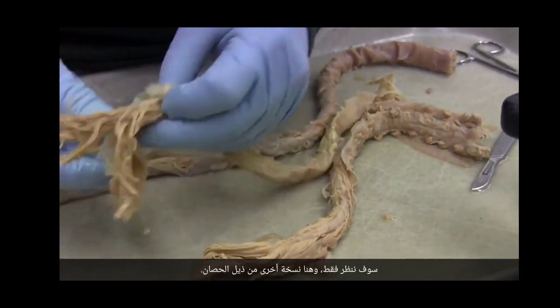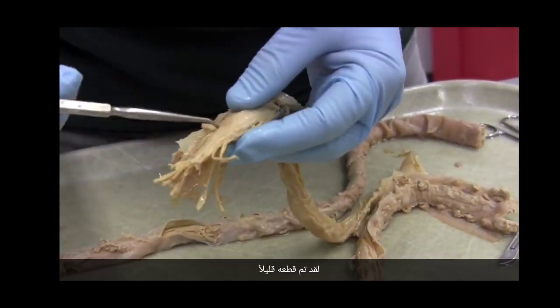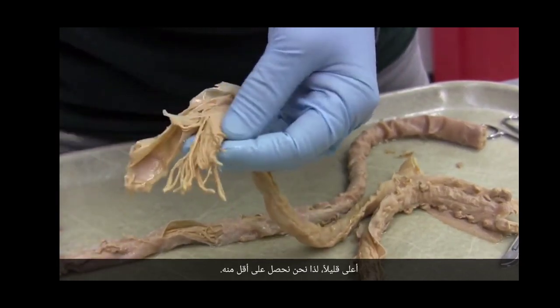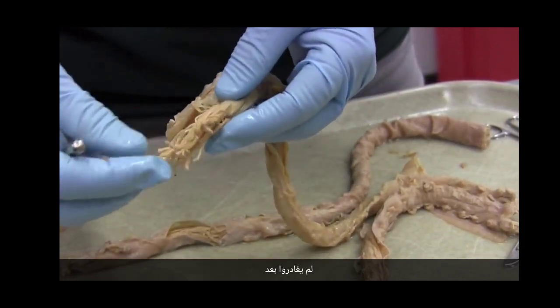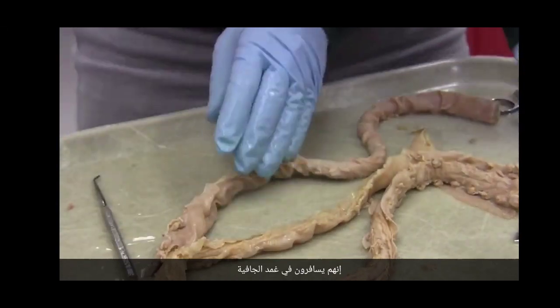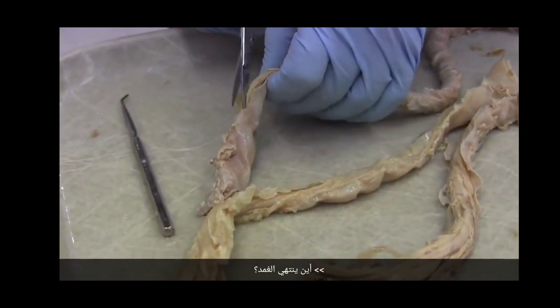We'll just look at, here's another version of a horse's tail. It's been cut a little bit higher, so we're getting less of it. But you see, here are all these roots. They haven't exited yet. They're traveling in the dural sheath. Let's look at the one on this spinal cord.